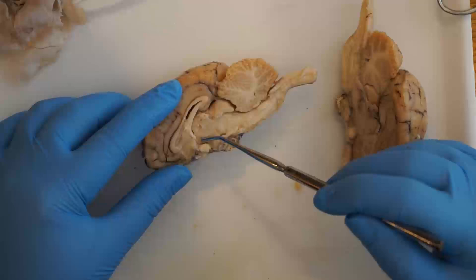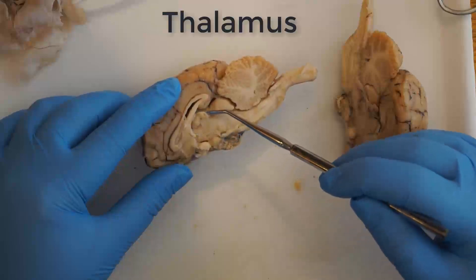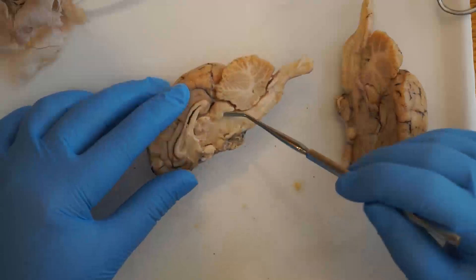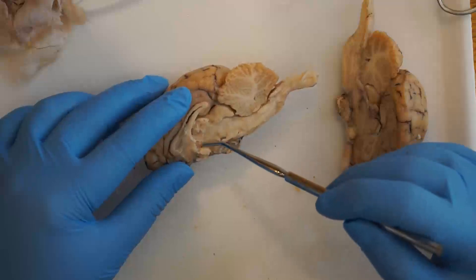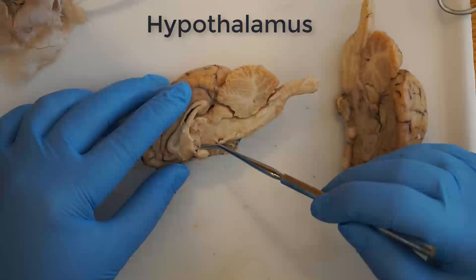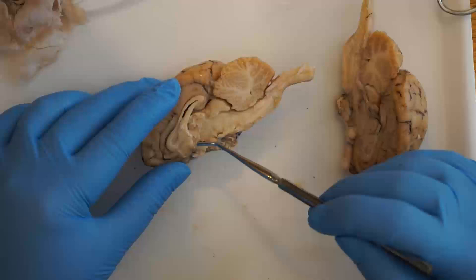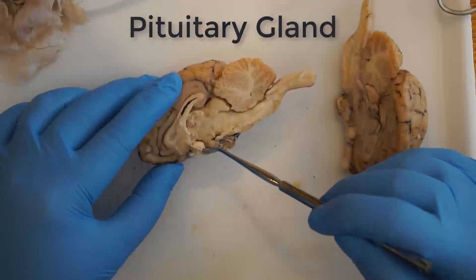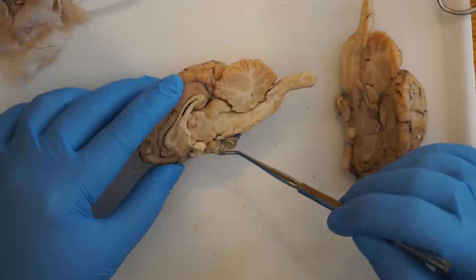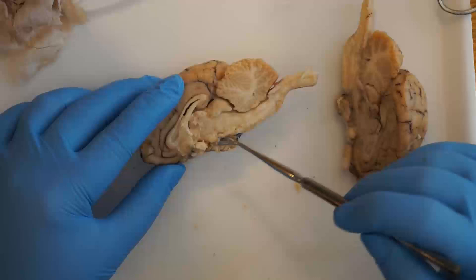Below the corpus callosum you'll find the thalamus, which relays impulses from your senses to the cerebral cortex, or outer layer of the cerebrum. Below the thalamus is the hypothalamus, and the pituitary gland, which is found below it — both are responsible for secreting hormones throughout your body. We'll talk more about those as we get into the endocrine system.